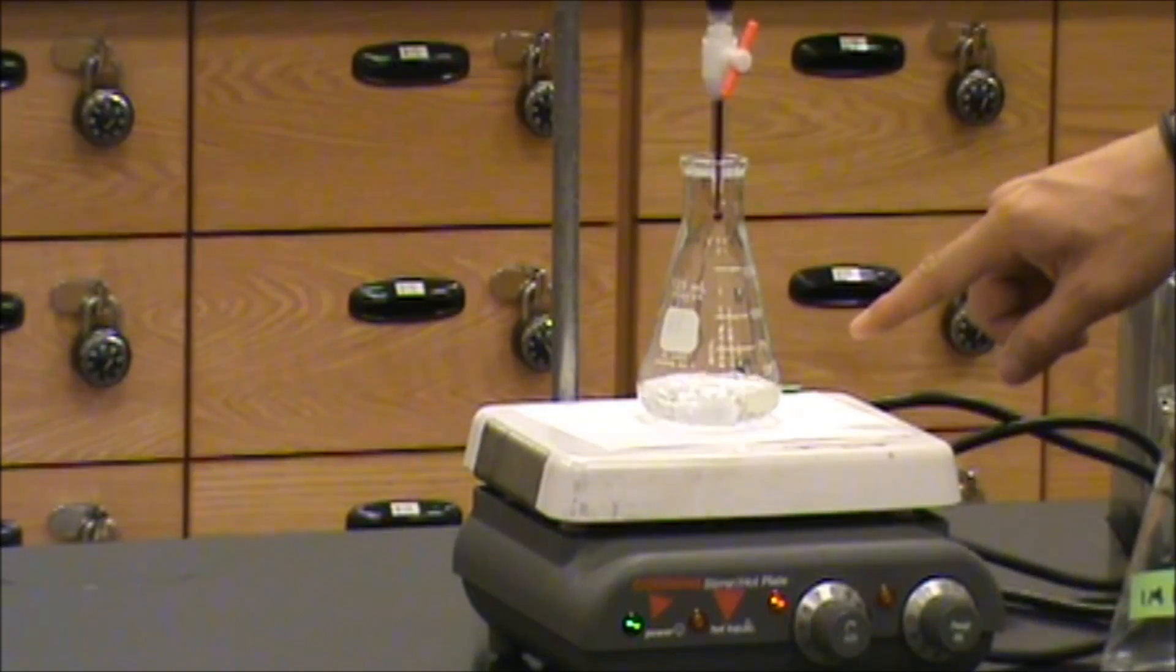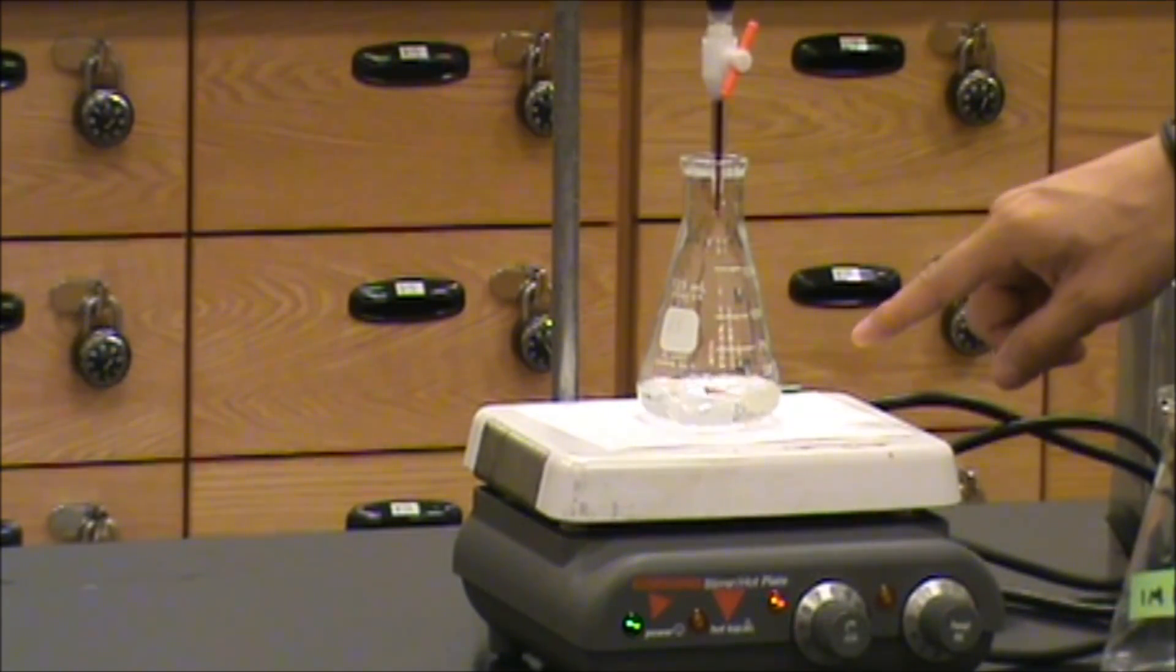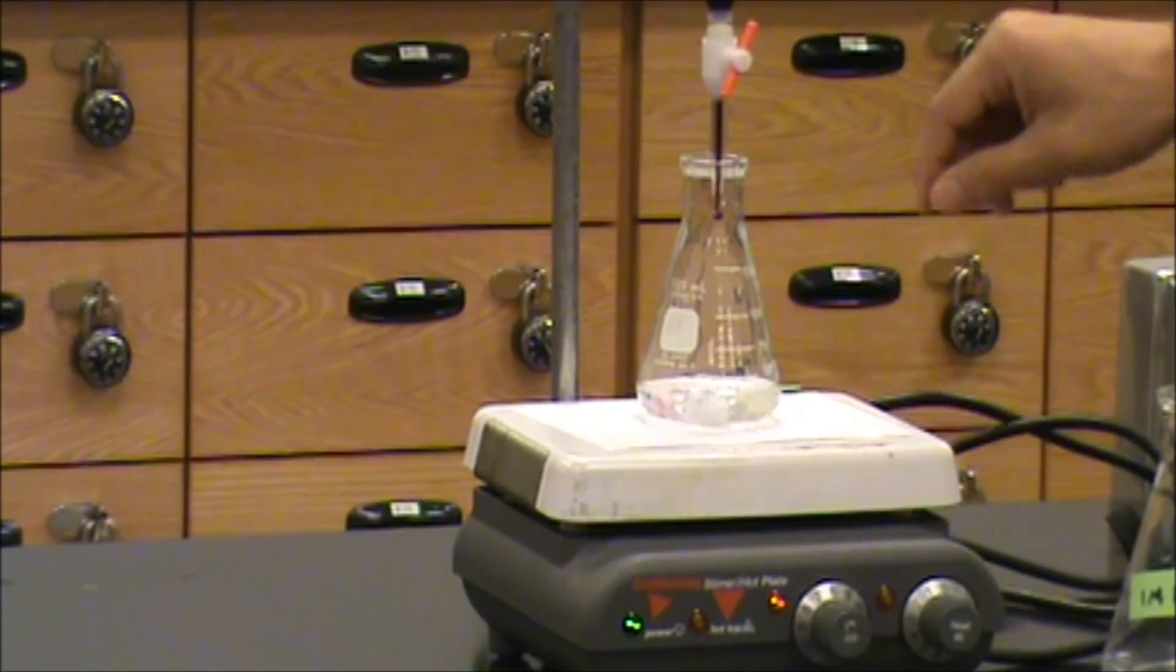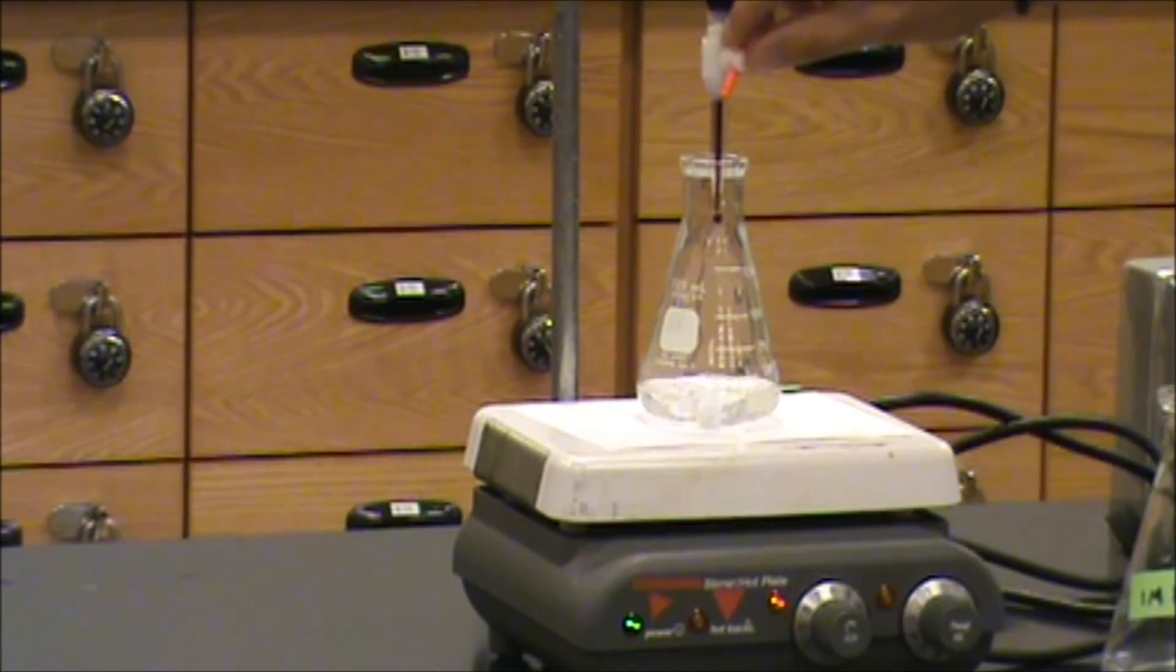You'll notice that these flashes of purple color are starting to linger longer and longer, indicating that we're closing in on our endpoint.